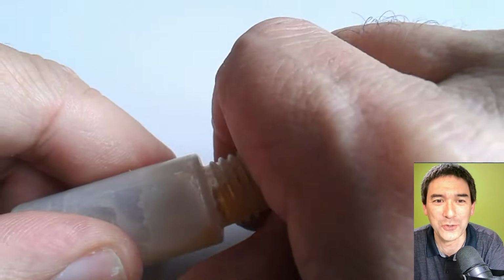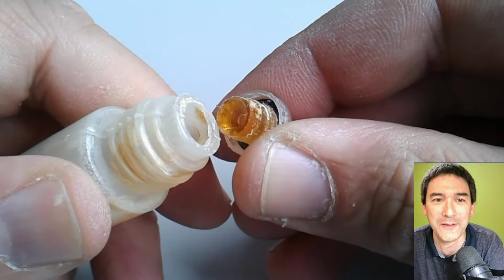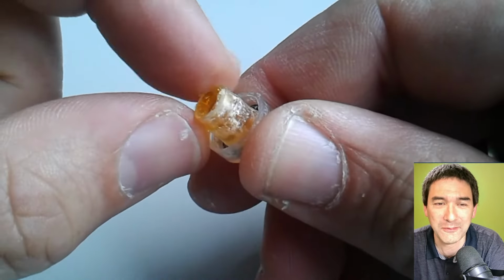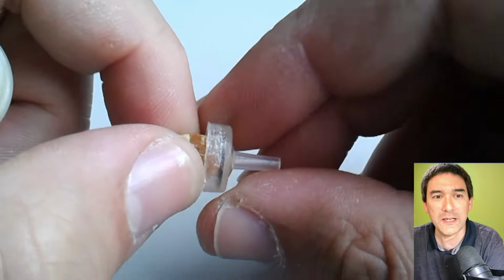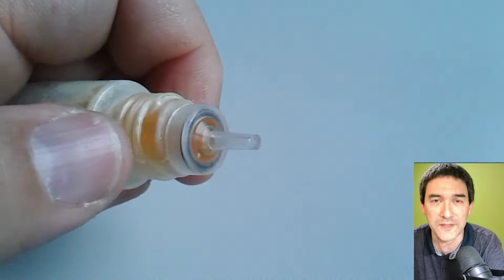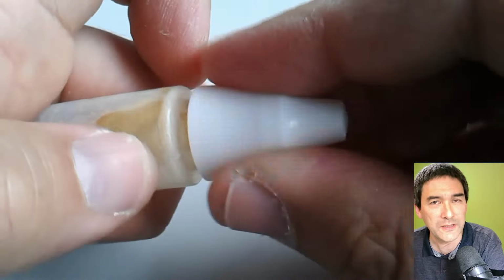I also tried to open the bottle, and look how solid it is, because some of it is actually solidified right here in the lid as well. It's like glue, kind of. So this should be a little bit of an indicator or a warning that you have to properly clean your microscope objectives afterwards. Okay, I just wanted to share this with you. Some kind of extreme cases.